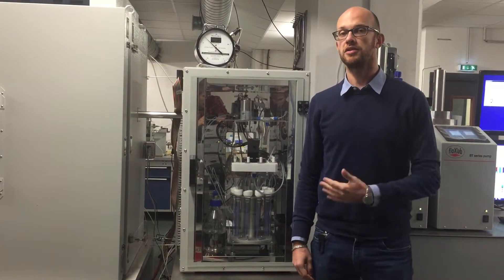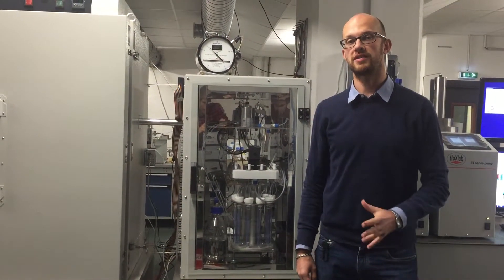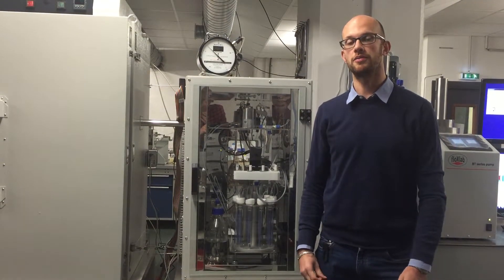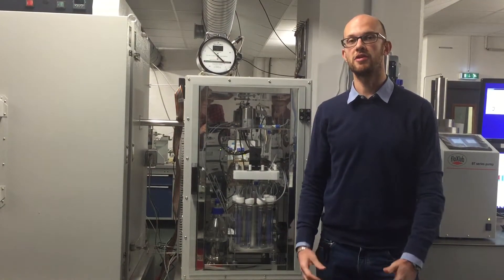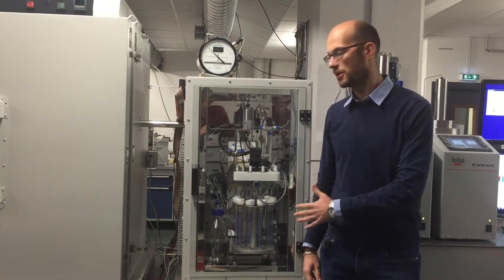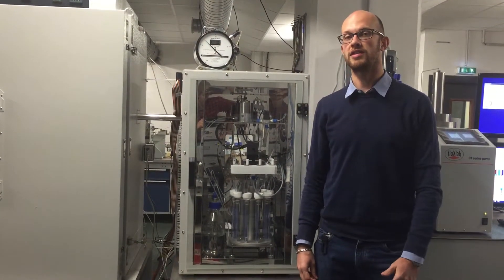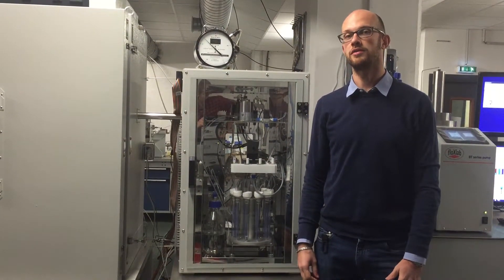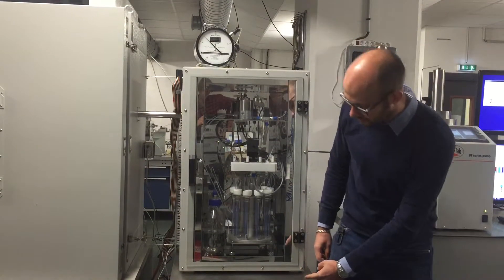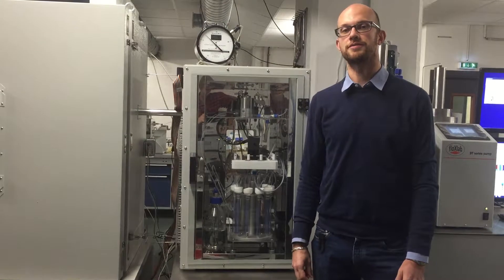In this auxiliary oven, we have the back pressure regulator that sets the pressure for the entire system, and also means of measuring what's coming out of your sample. Mounted inside the auxiliary oven, we have the gas-liquid separator and fraction collector. At the bottom, we also have the liquid-liquid fraction collector.